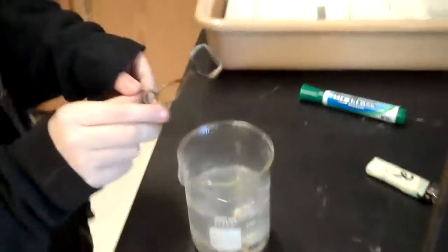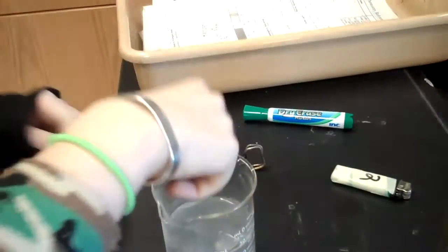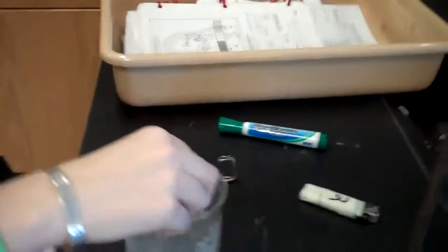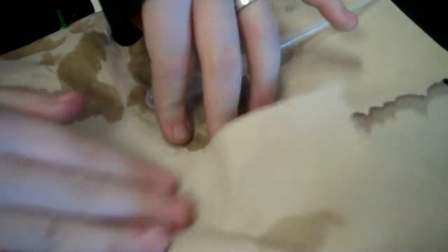You can just use your fingers. Oh, good. Here you go. And pat it dry. I'm going to try to wipe off any excess zinc that is on there. Okay.